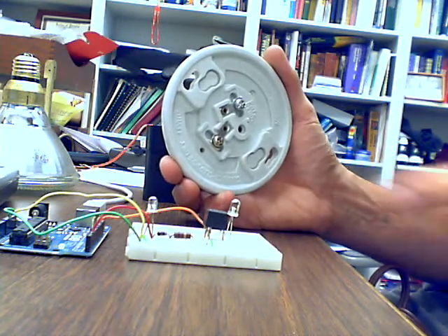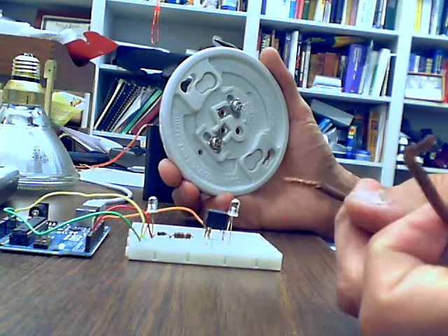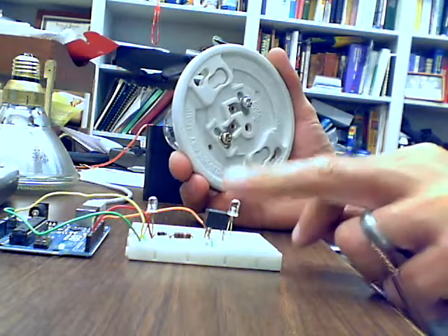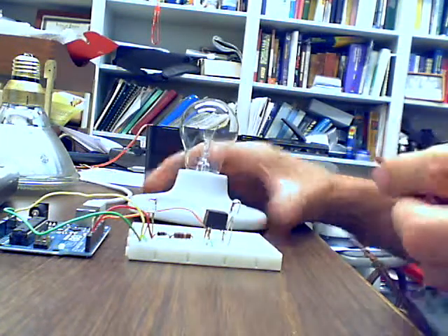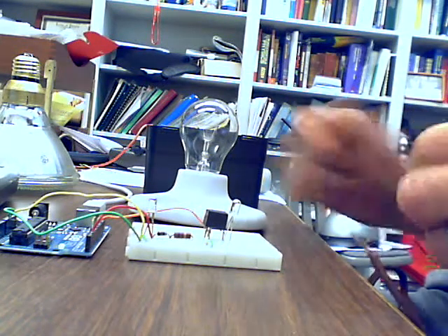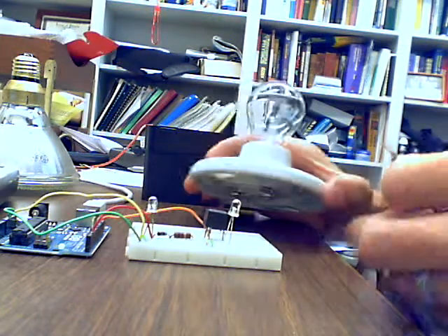One thing I should say is that I use the LED for prototyping because once you start playing with the electricity from the wall, it gets you into a pretty dangerous situation. So it's a really good idea to prototype with this where you can't hurt yourself. And then once you start to deal with the electricity from an outlet, you want to be extremely careful making these connections. Always keep it unplugged until you're ready to test everything and your hands aren't connected to any of it.